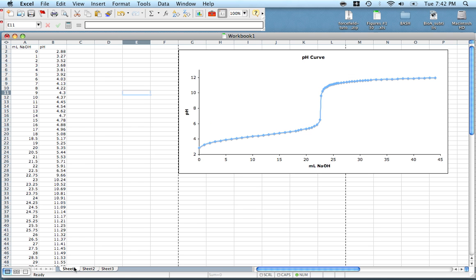Okay, so I'm going to break this up into 3 columns here. The first column I'm going to do is delta V. Again, delta V was just volume 3 plus volume 2, divided by 2, minus volume 2 plus volume 1, divided by 2. So I just click on this cell and there's this little blue box right here. You just want to put your cursor over that until that black cross shows up and drag that over one space. We'll call this delta pH. So what that's done is copied that same equation over for the pH values.